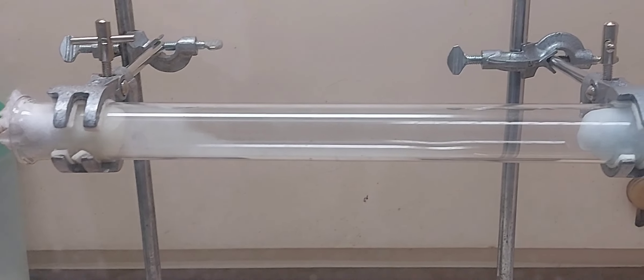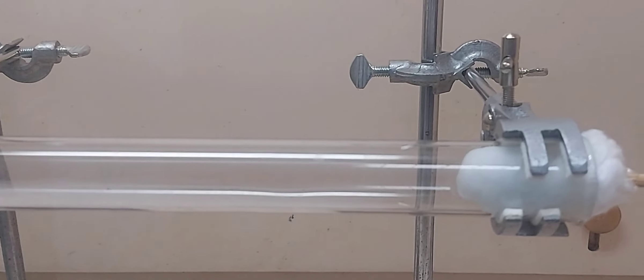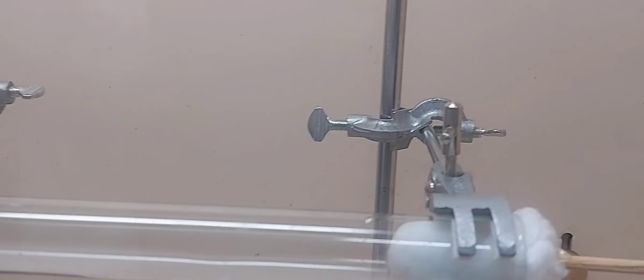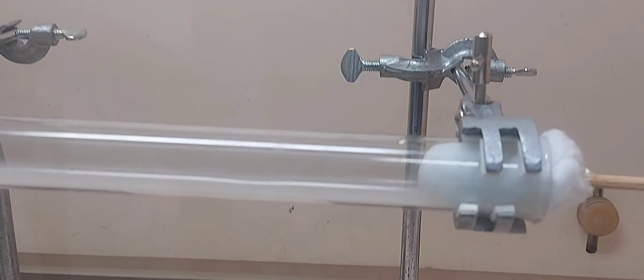So you can see white fumes and you can see the solid which is being formed at the bottom, the white solid. What do you think is the white solid?